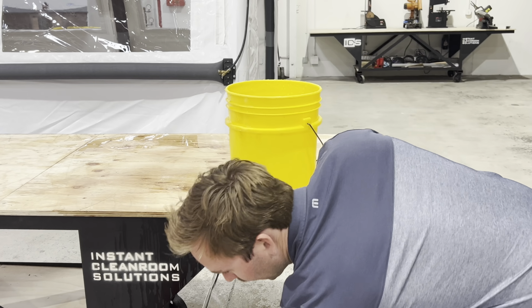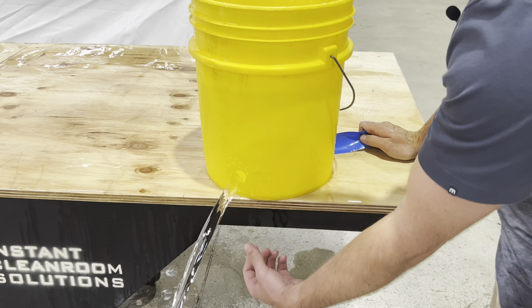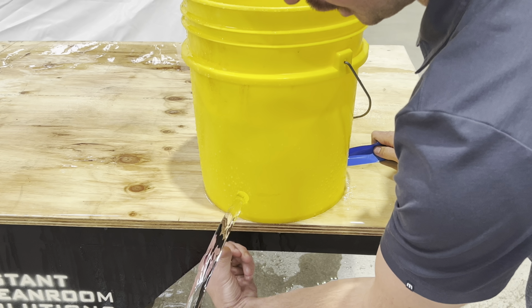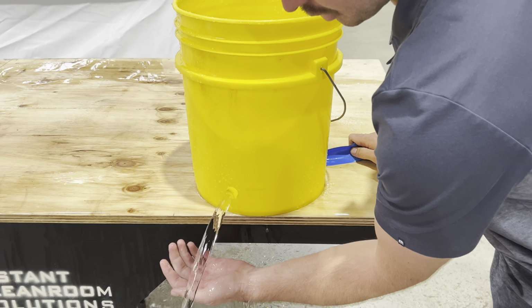And you can see how quiet it is as it enters in. It looks like glass right here. I know exactly where it's coming out. If I put my thumb on it, it fans out in a uniform direction.